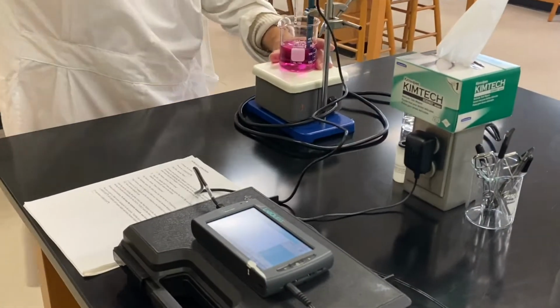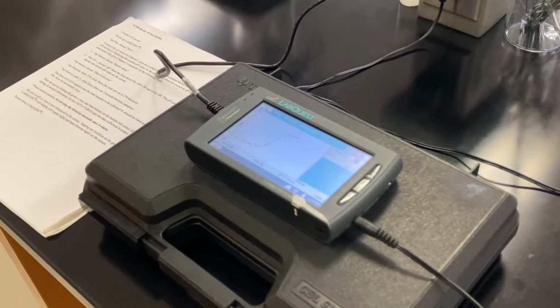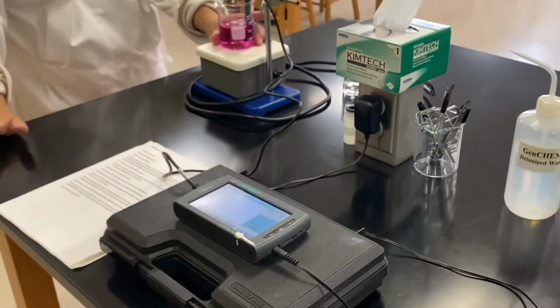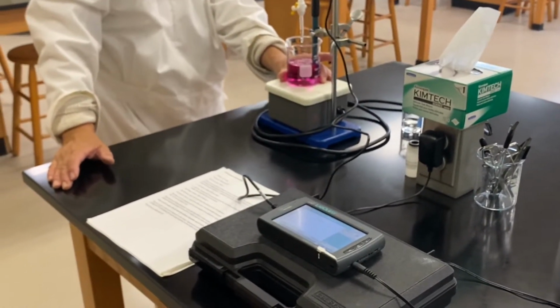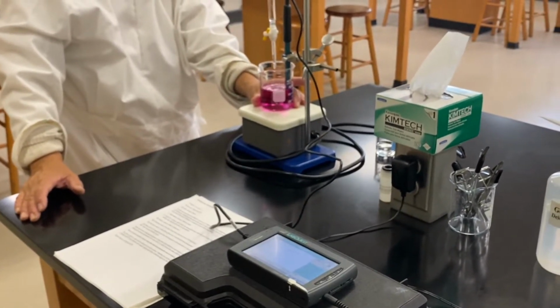In order to get the entire titration curve, we would like the system to do its work. So leave everything untouched, just let the system run its own course. All right, and it looks beautiful.